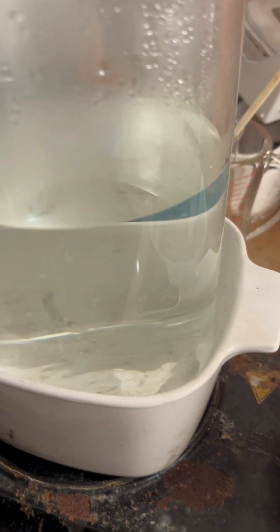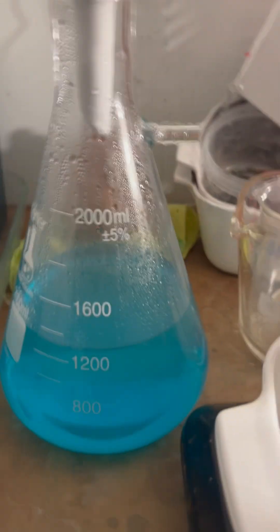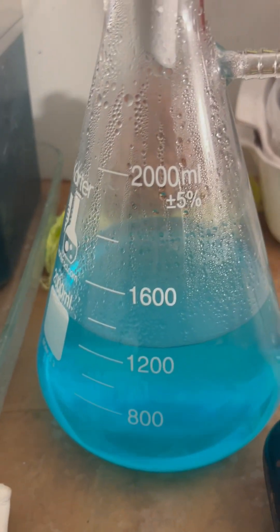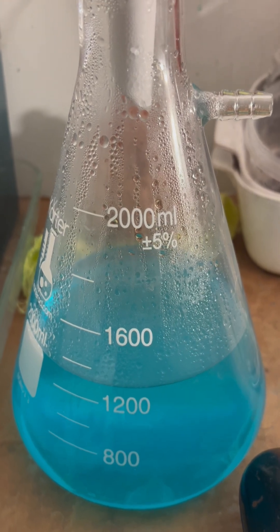I'll use this clean rinse water for the silver sludge, and this right here will probably go into a resting tank, and then I will treat it, and I'll probably just put that in with my paper.